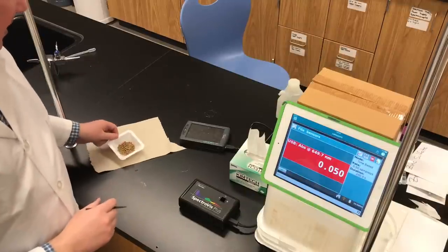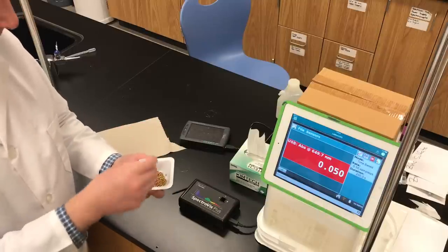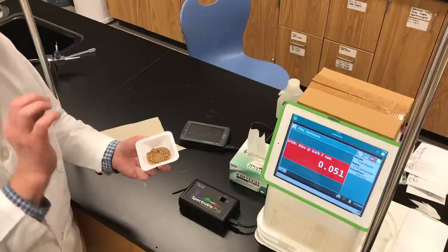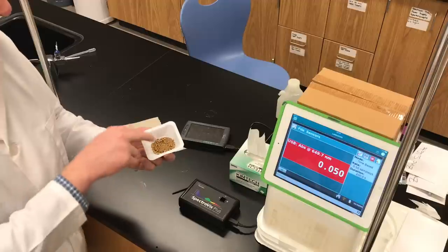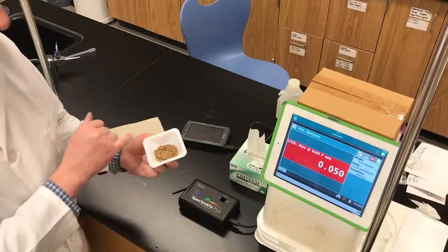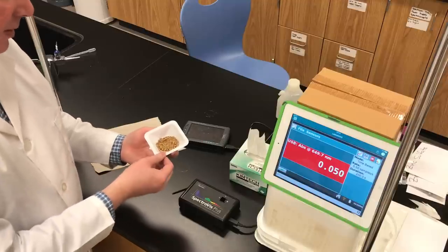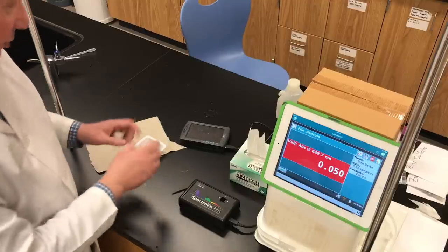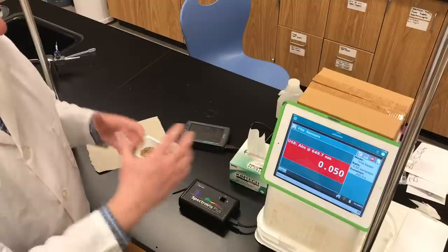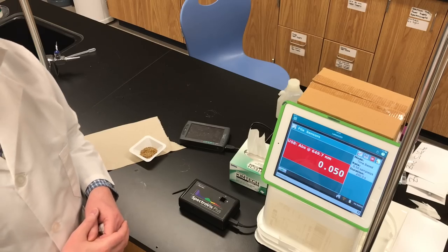In this lab, we are going to take a sample of brass. Brass is an alloy made of copper and zinc — in this form, it's pellets. Our job in this experiment is to figure out the percentage of copper in a brass sample as a mass percent. We're going to dissolve the brass in nitric acid, then measure absorbance values using spectrophotometry and Beer's Law to find the percentage of copper.